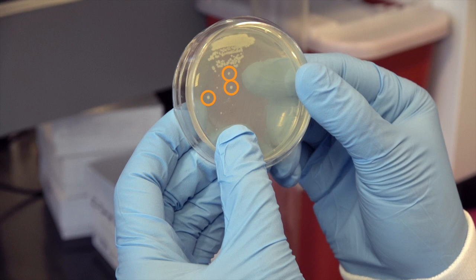As you can see, our careful streaking has resulted in individual colonies that can be picked for a wide variety of downstream experiments.